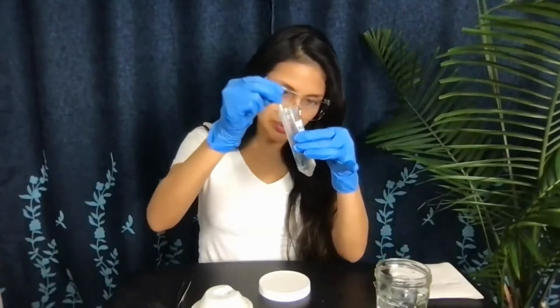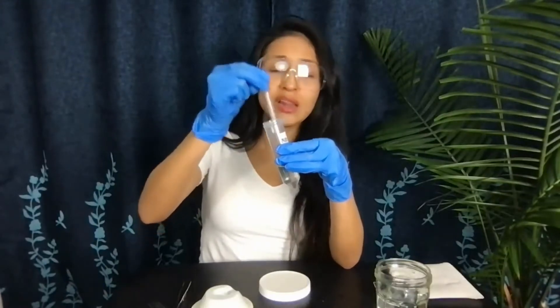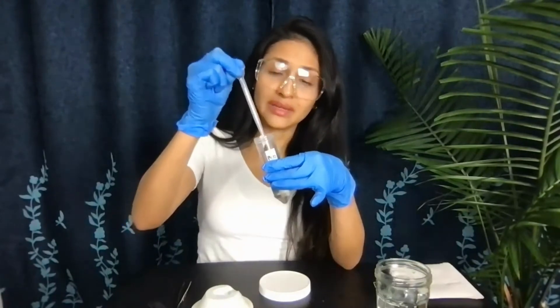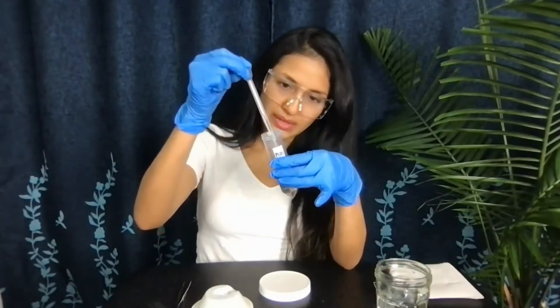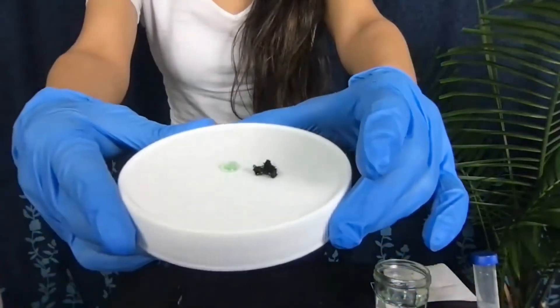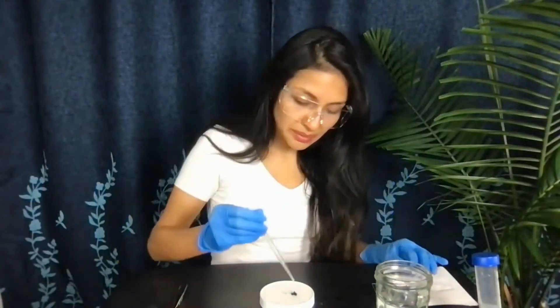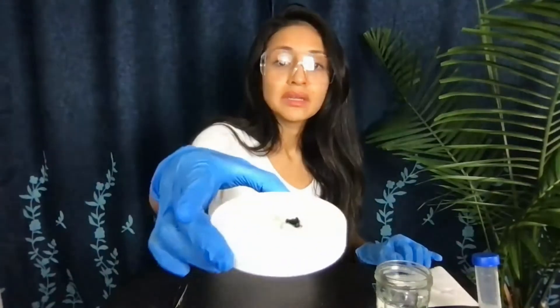It's completely fine to chop this up as much as you can. Remember that most of these algae are actually a lot of microorganisms coming together as a community, which is why it looks like just one thing. They also like to stick to glass if you grow them in a glass container. I'm going to grab some clean water and mix it in — just a teeny tiny bit, enough for it to be wet, because it's harder to break up these chunks when they're a little dry.